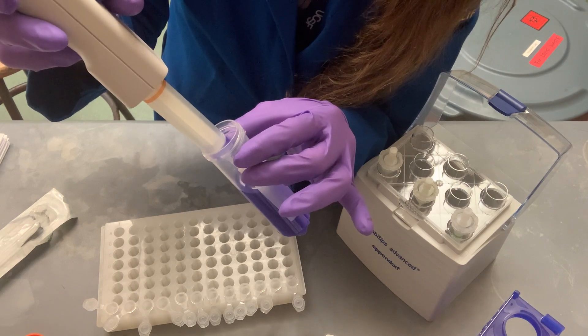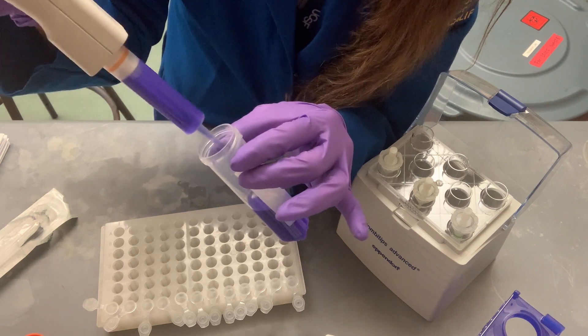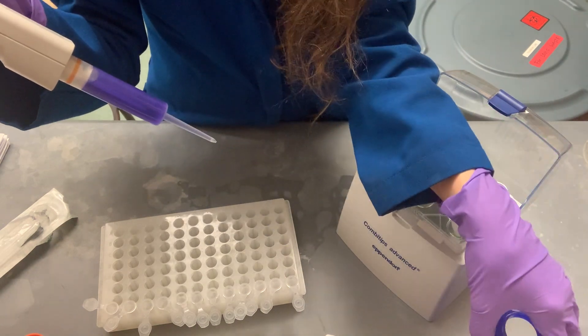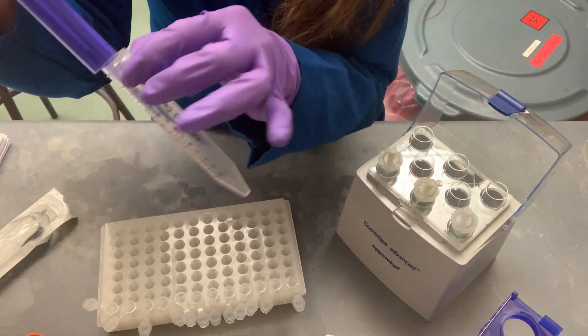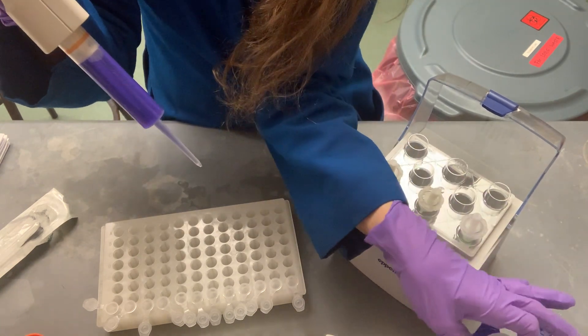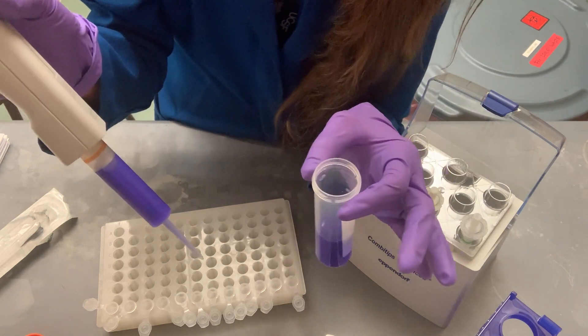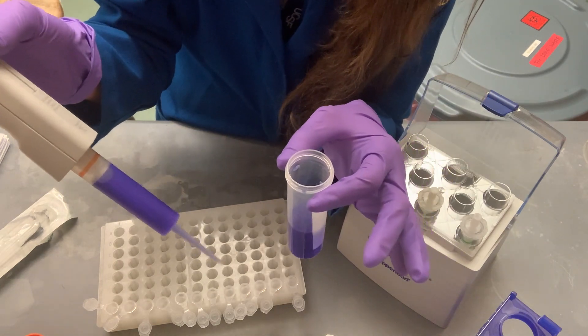Note that because the tips are really fat, some won't fit into certain tubes. For example, the 10 mL tip won't fit into a 15 mL falcon tube. So if you want to pipette from a 15 mL falcon tube, you'd still need to use a 50 mL falcon tube, or transfer the liquid once you realize the tip won't fit.